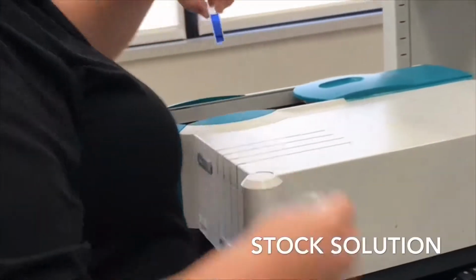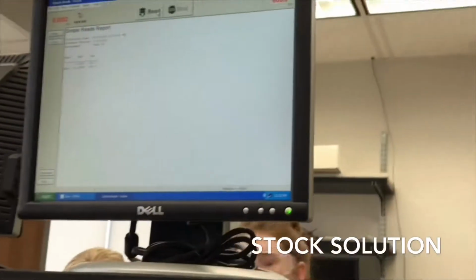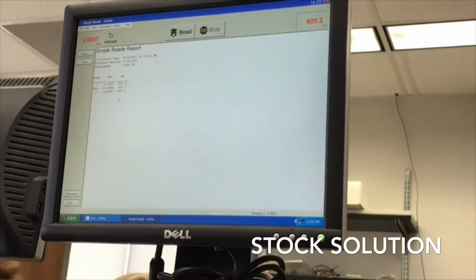We then place the stock cuvette in and read the absorption. We repeat this process of alternating the blank and dilutions for our 3 serial dilutions to find their absorption.